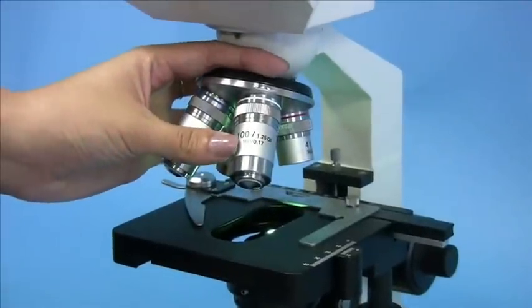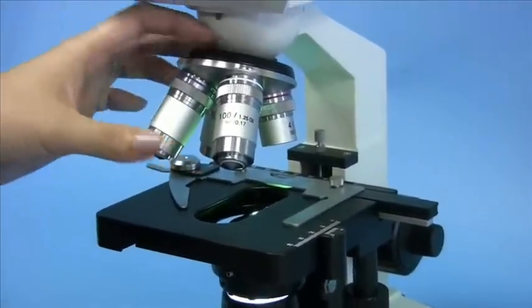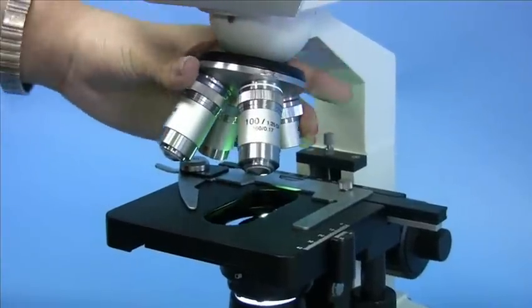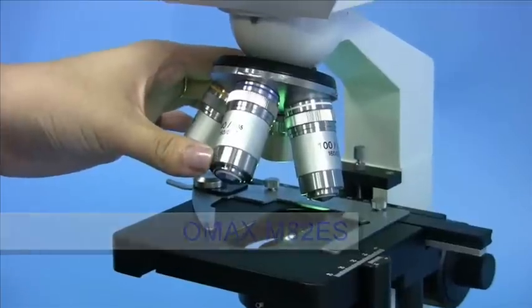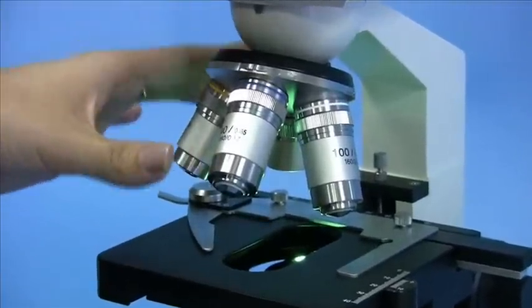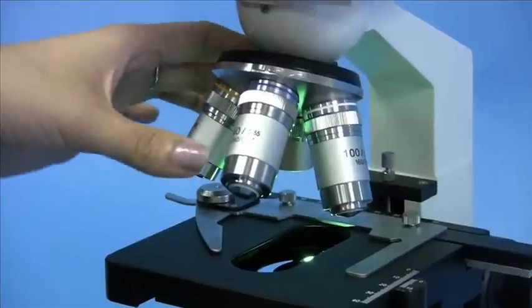So when you're using the 100x objective, you have to use it with the oil. But when using it, make sure that the 40x that does not require the oil is dry and does not touch the oil. Otherwise, it will damage the objective.